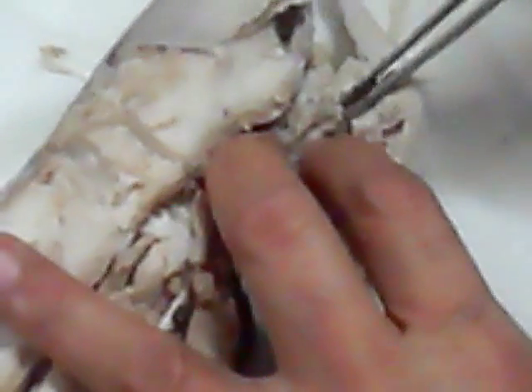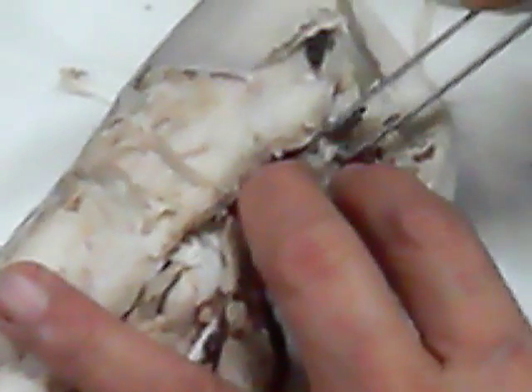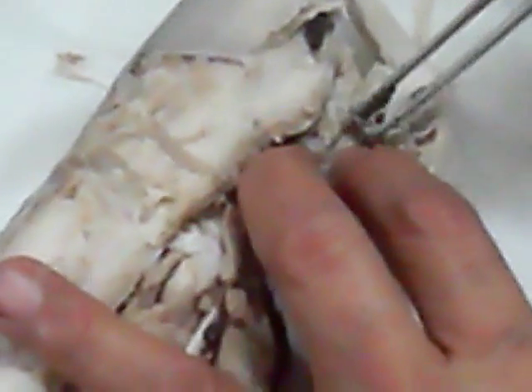The papilla here is not very clear. There — the papilla.